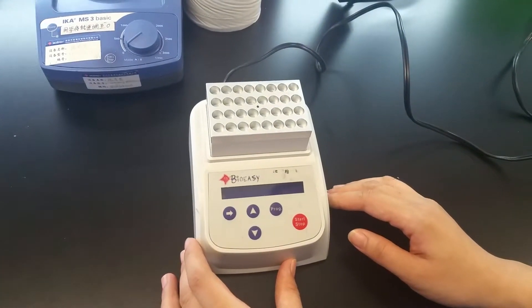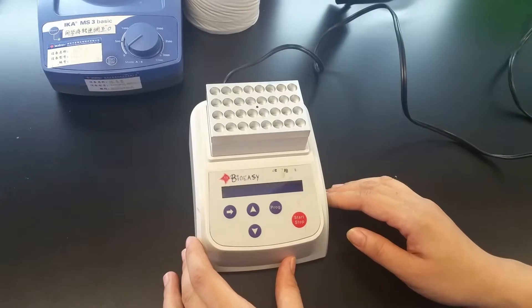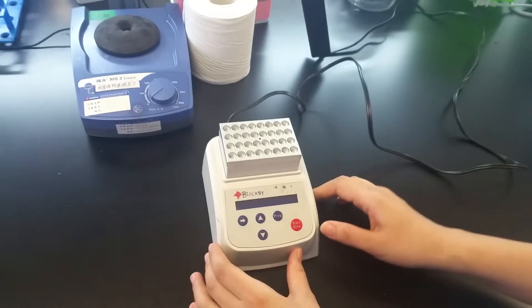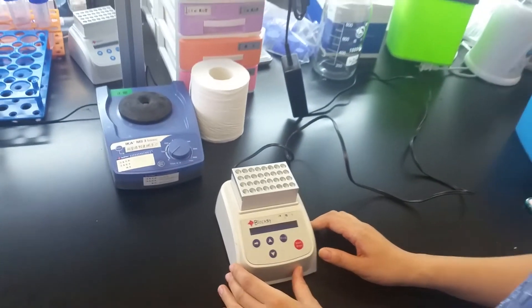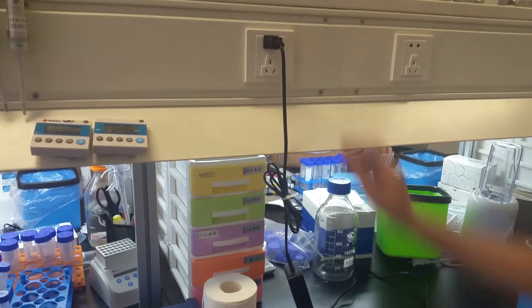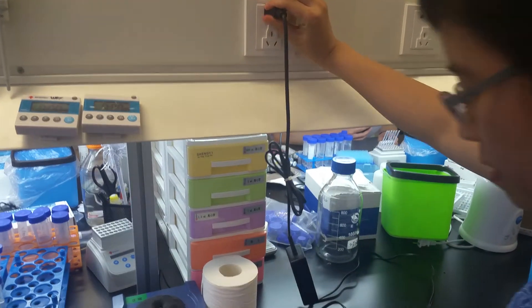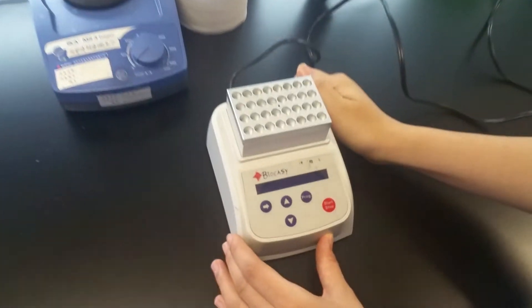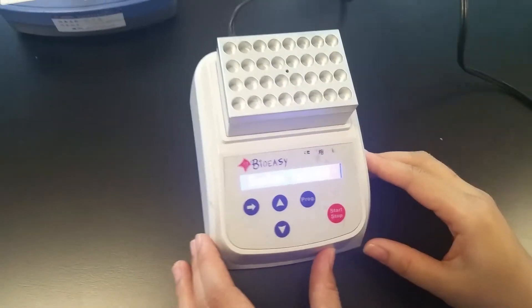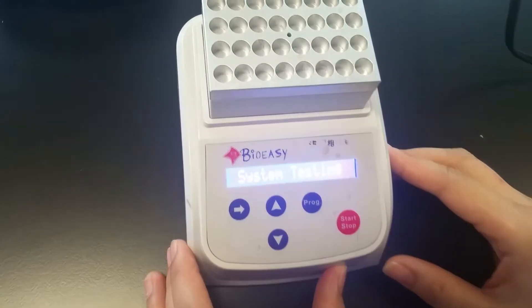Today we will demonstrate how to set the time and temperature of BioEasy Mini Incubator. First, plug in. Then turn on the power. We can see system testing.